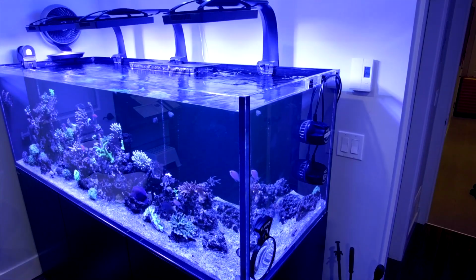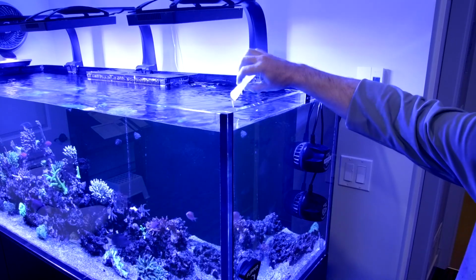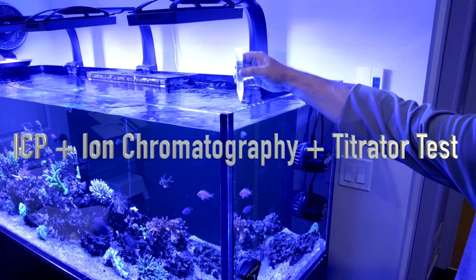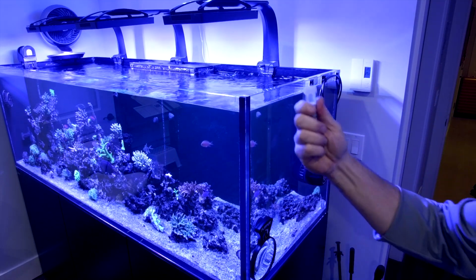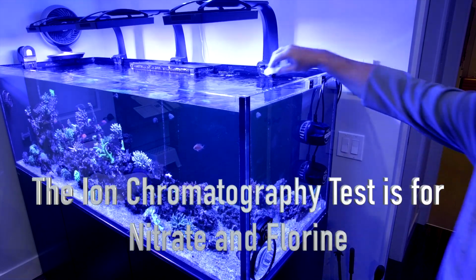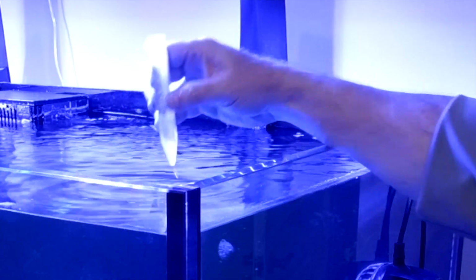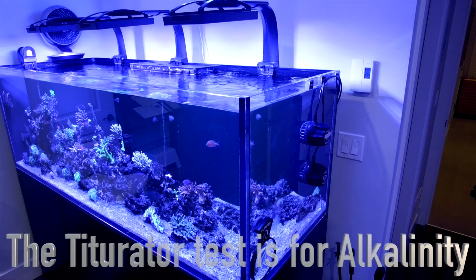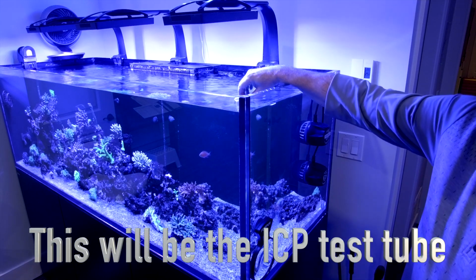We're going to take the ATI samples. The ATI has 3 different tubes. I'm not 100% sure why, whether they do more testing or they test differently, but anyways, I got 3 tubes, so here we go. There's tube number 1. Number 2. And this is the final water sample for the ATI.